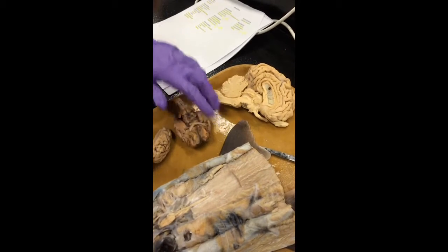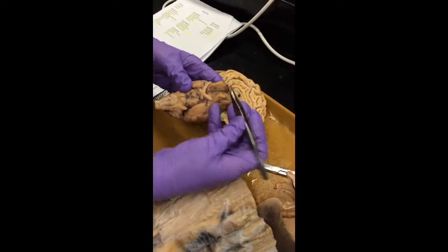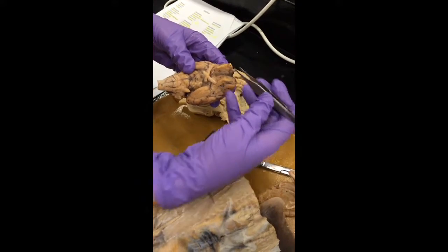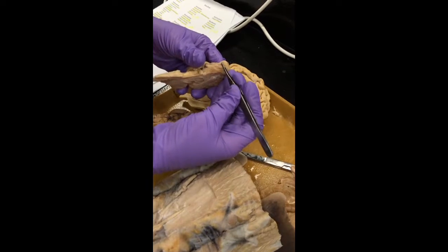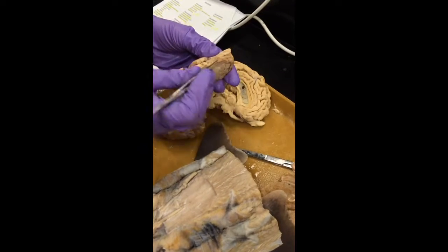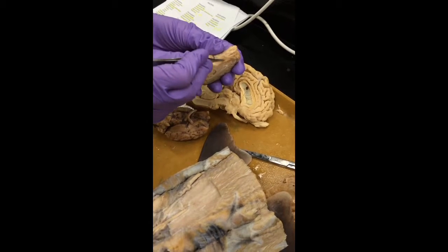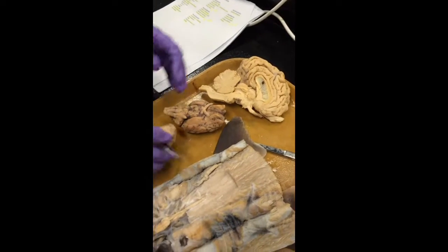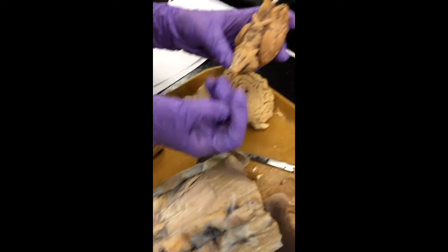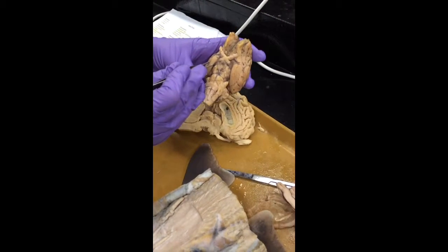The olfactory bulb. If we're looking right here, here's our olfactory bulb. There's another one. This one is a good one too. The bulb on the front there, sense of smell. And you should follow down the olfactory tracts, and you have a medial and a lateral. It's all kind of the same color, hard to see. The piriform lobe, we just did that. Right here is our piriform lobe.